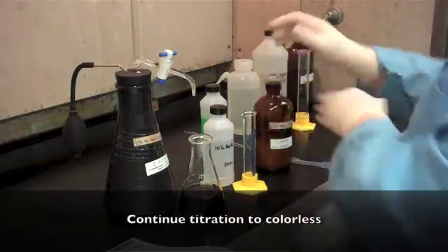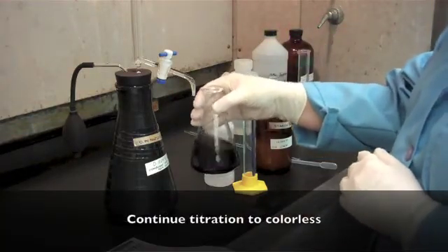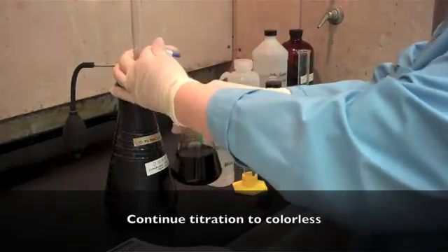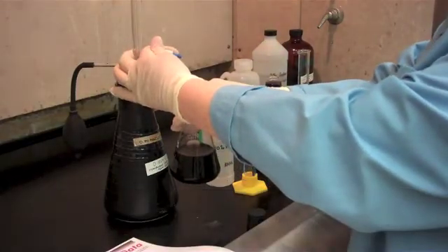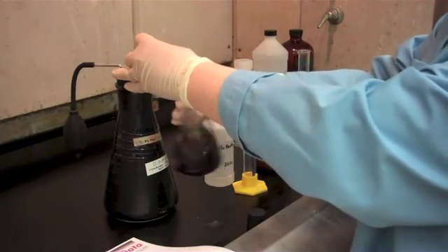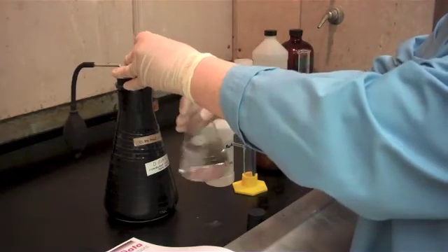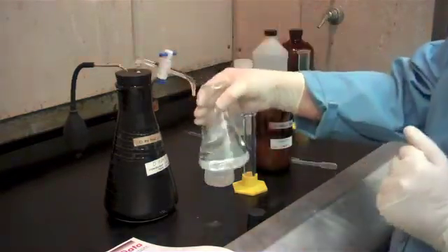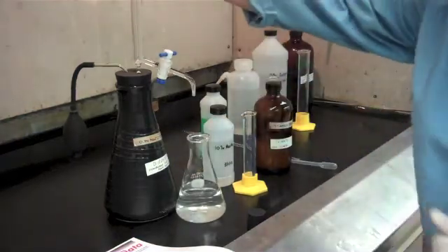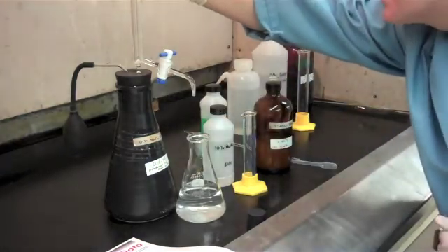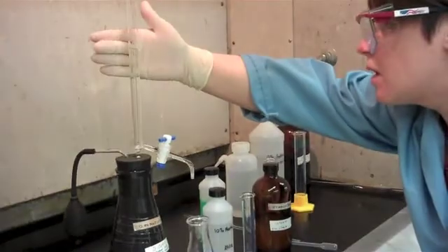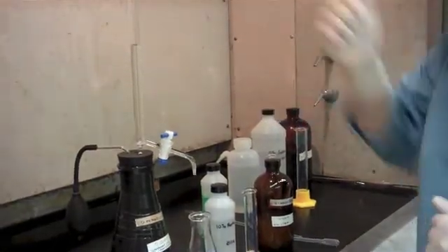And we're going to continue titrating with the 0.1 normal sodium thiosulfate to colorless. And we're going to record our milliliters: 12.1.